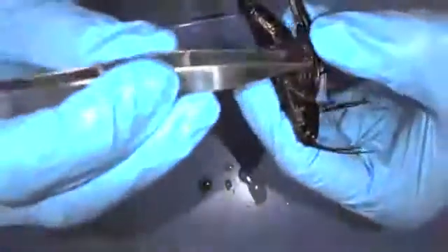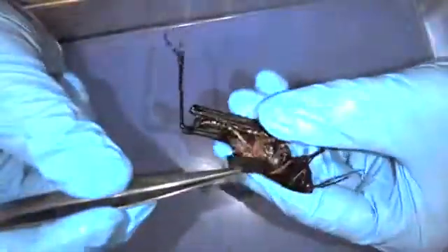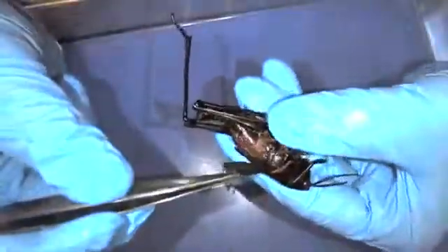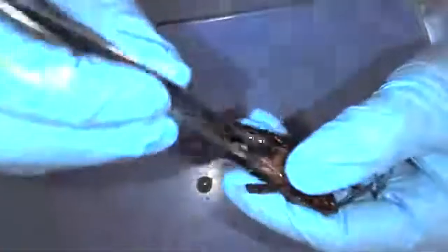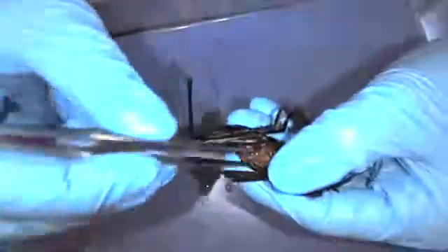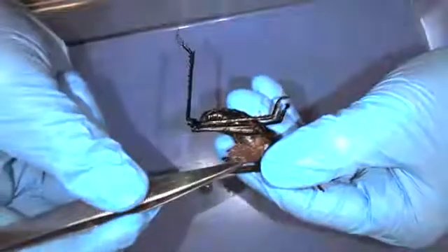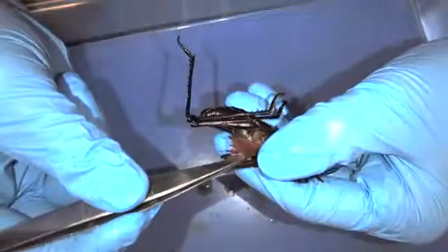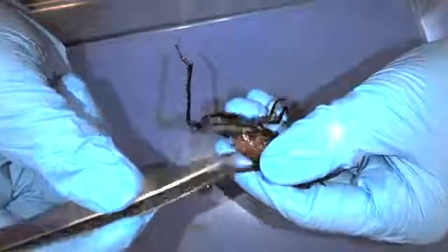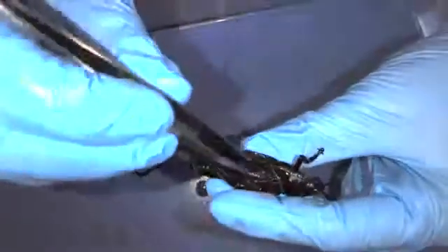They also have wings on their body, which helps them fly. They have two sets of wings — here's one layer; they kind of sit on top of each other. The top layer is harder and helps protect the wing underneath. That lower wing is a lot thinner and more delicate, but it really helps their flight. So the top layer is more protective while that bottom layer handles flight.